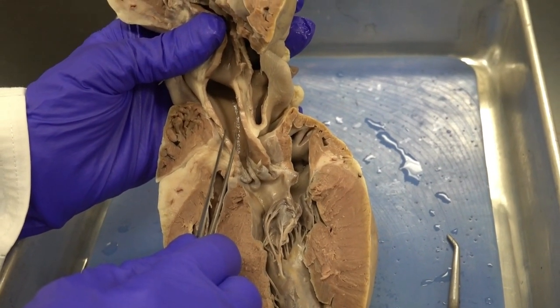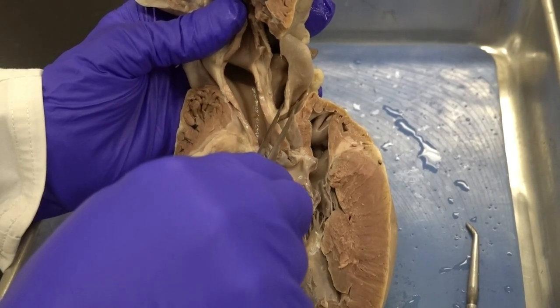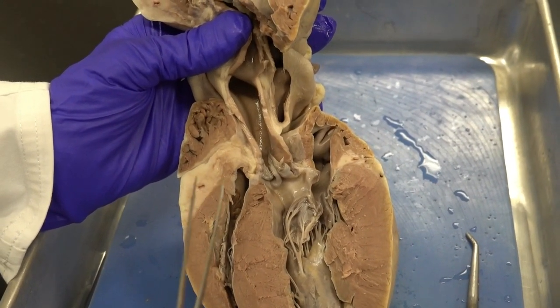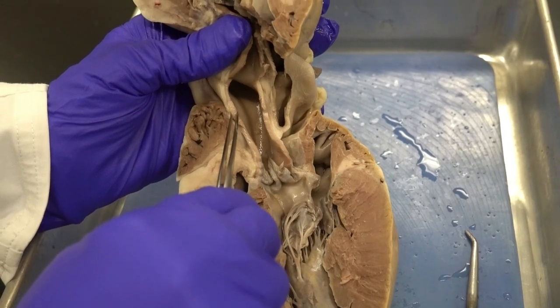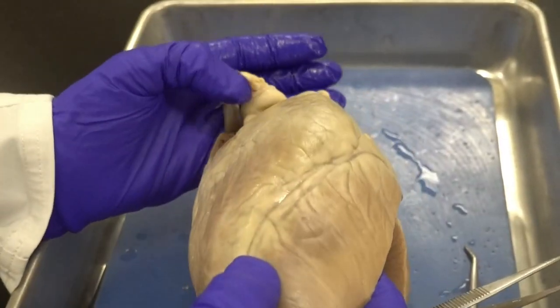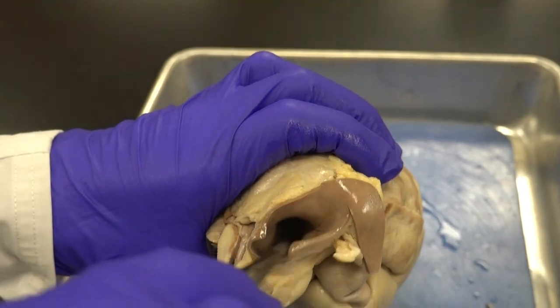Notice how wide open the aorta is compared to the pulmonary trunk. At rest the aorta experiences pressures from 80 to 120 mmHg generated by the left ventricle, whereas the pulmonary trunk only experiences pressures of 20 to 30 mmHg at rest. Therefore the pulmonary trunk does not need as thick a wall as the aorta, and when blood is not flowing, the pulmonary trunk tends to slightly collapse — visible in the external view — while the aorta stays wide open.